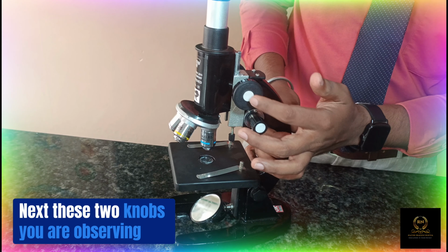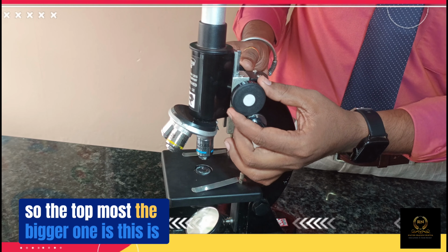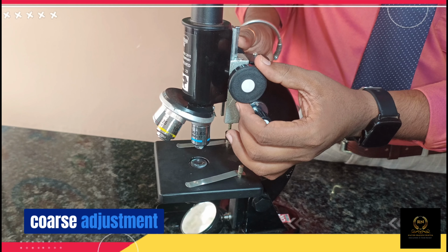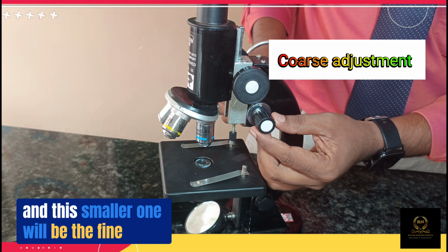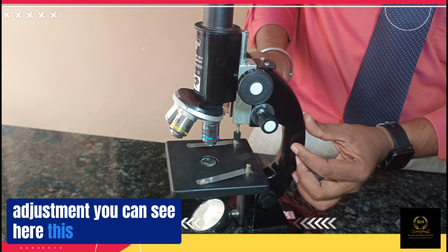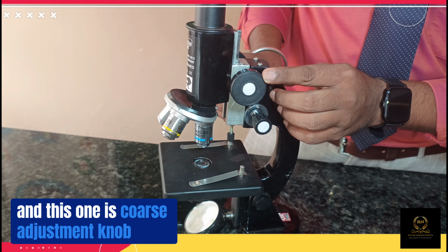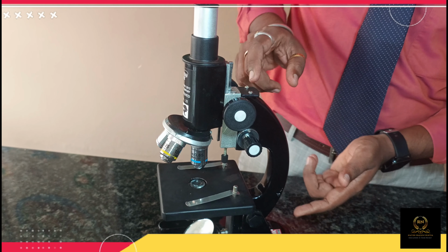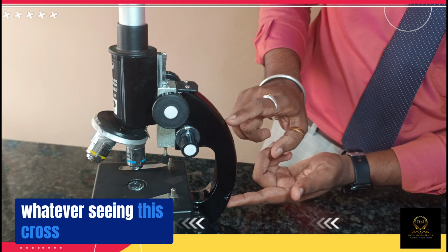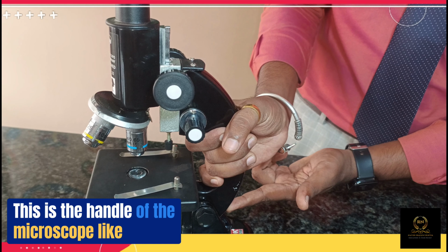Next, these two knobs you are observing. The topmost, bigger one is the coarse adjustment, and the smaller one is the fine adjustment. You can see here this fine adjustment knob, and this one is the coarse adjustment knob. And this part, this arm, is the handle of the microscope.